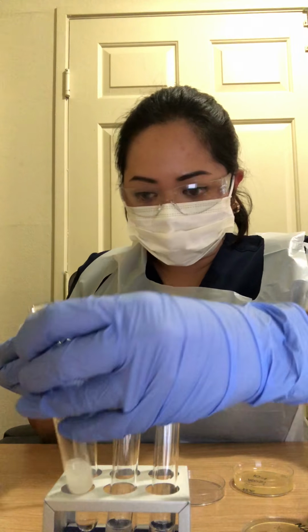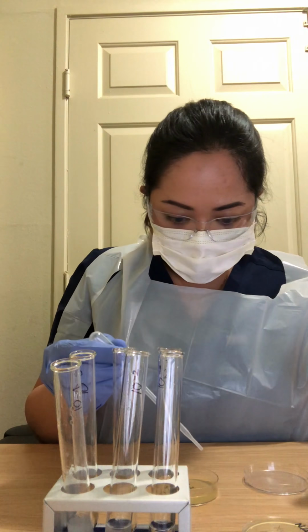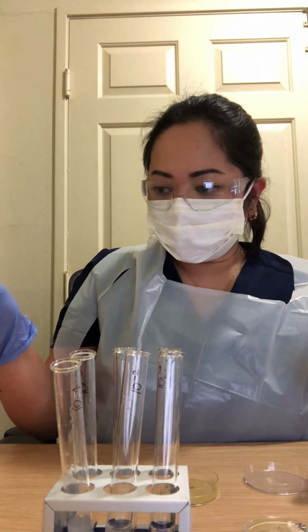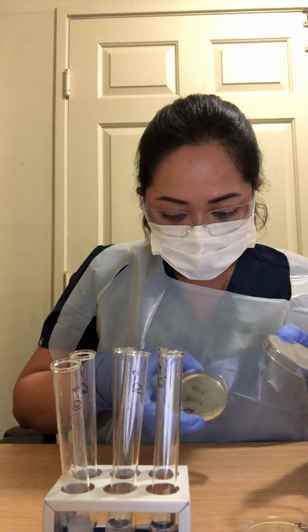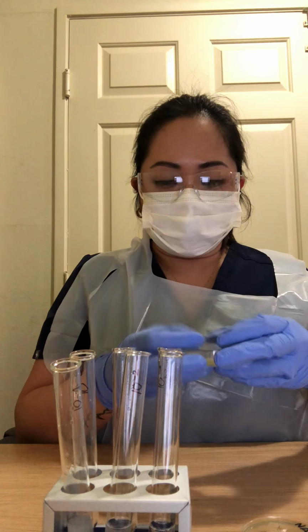So I'm just going to put 4 drops. 1, 2, 3, 4, and then I'm going to swirl it, make sure you got all the surface, and then cover it.